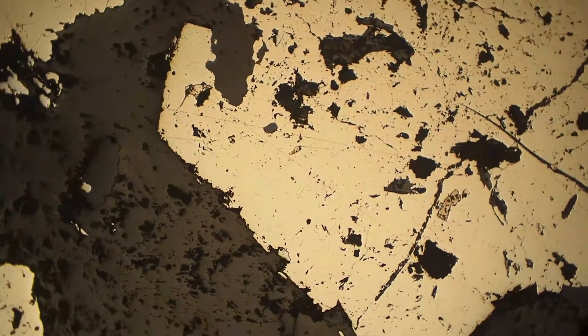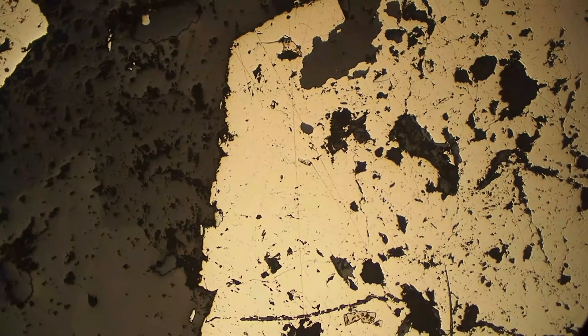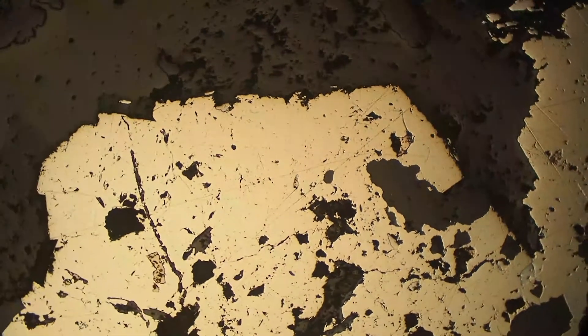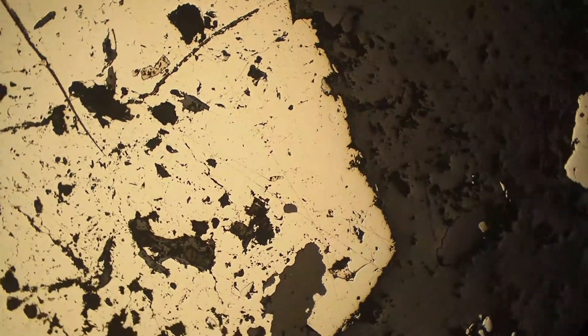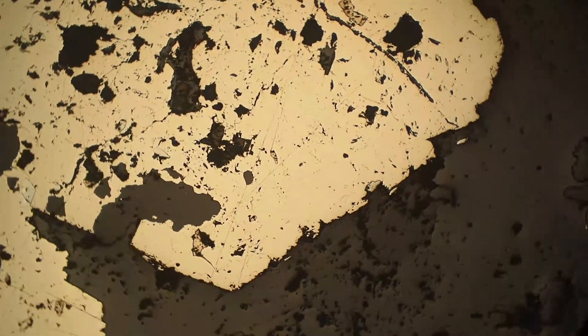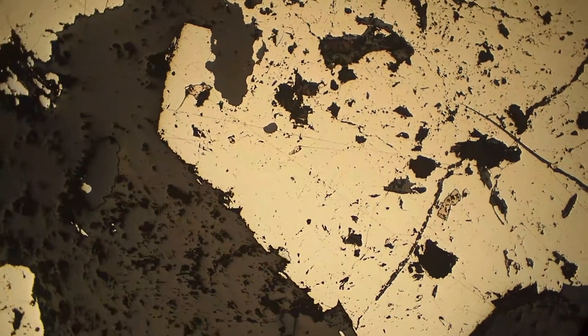Also it's got a distinctive light yellow colour to it, and you can see rotating this stage it's just staying that constant same colour, so it is not bireflectant. If it were bireflectant it would be changing colour as we rotate.